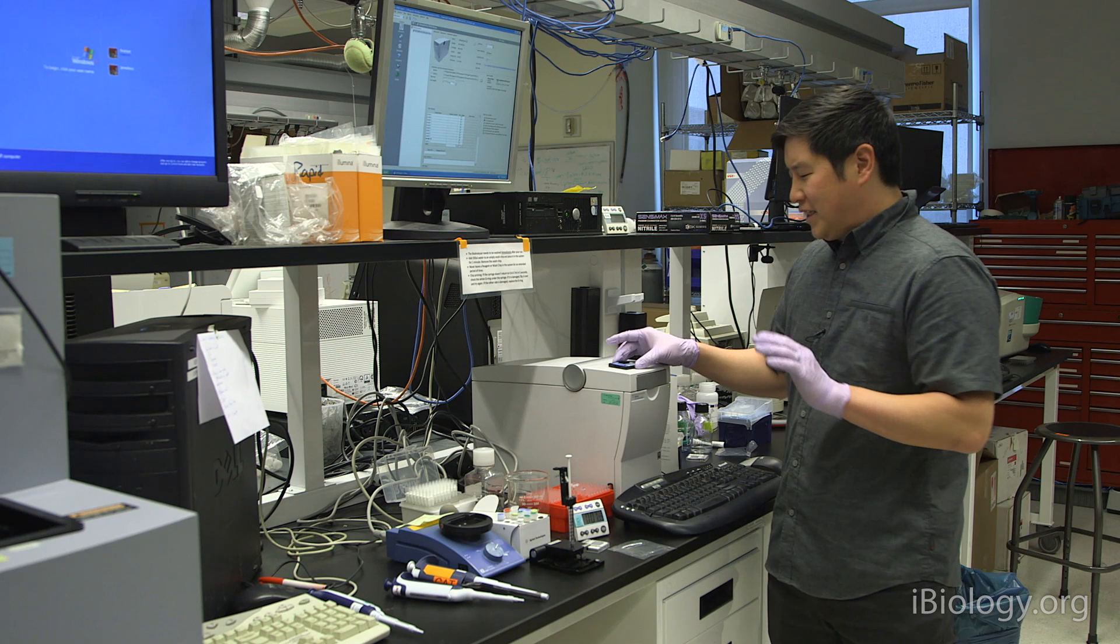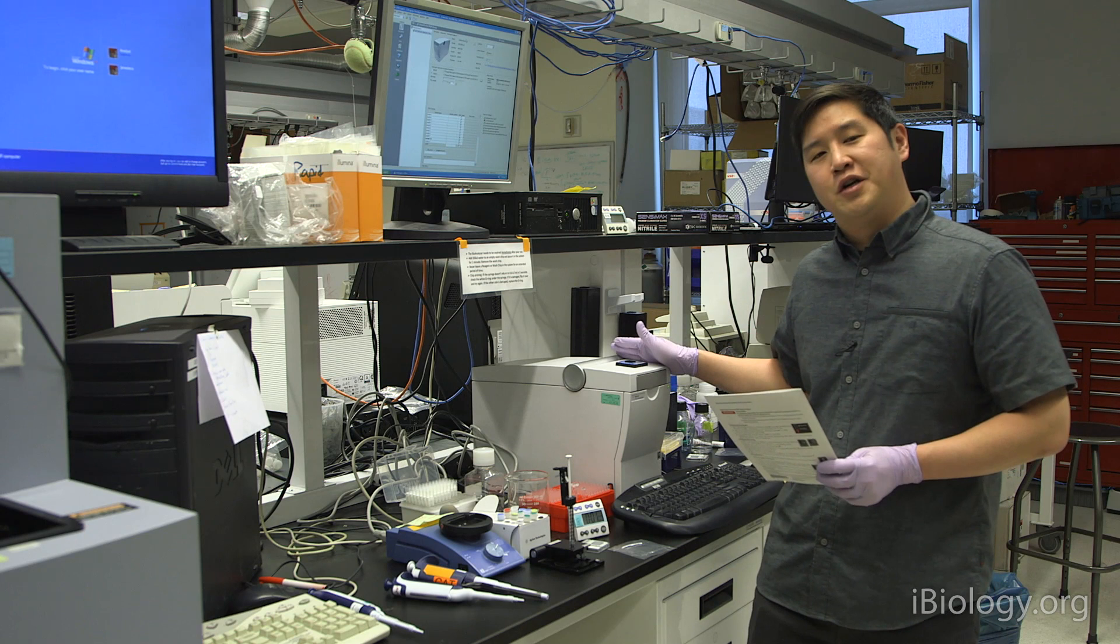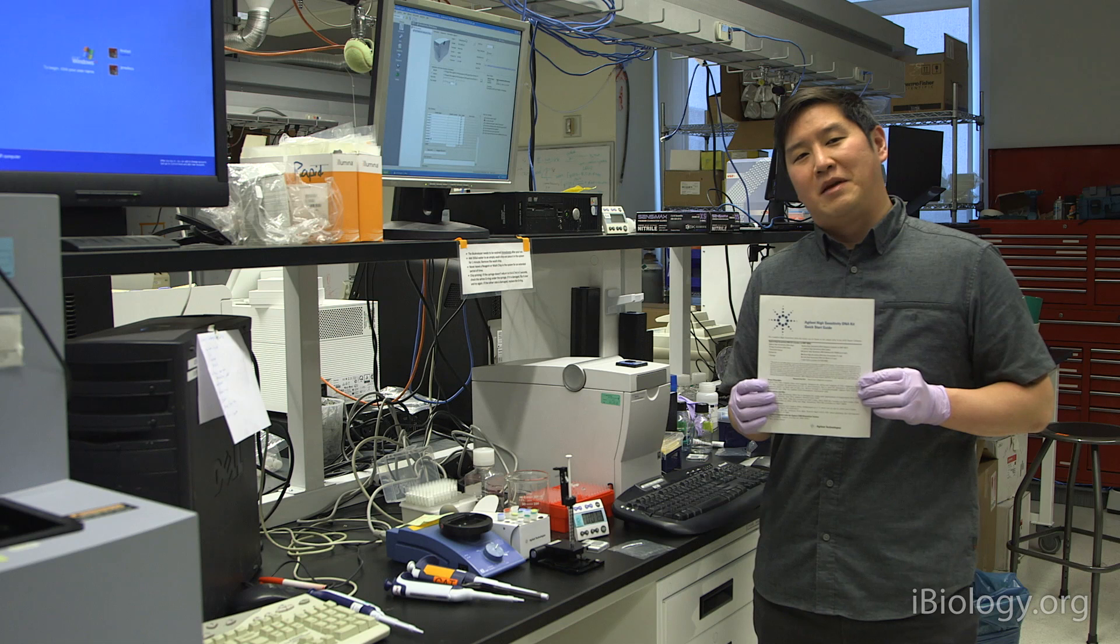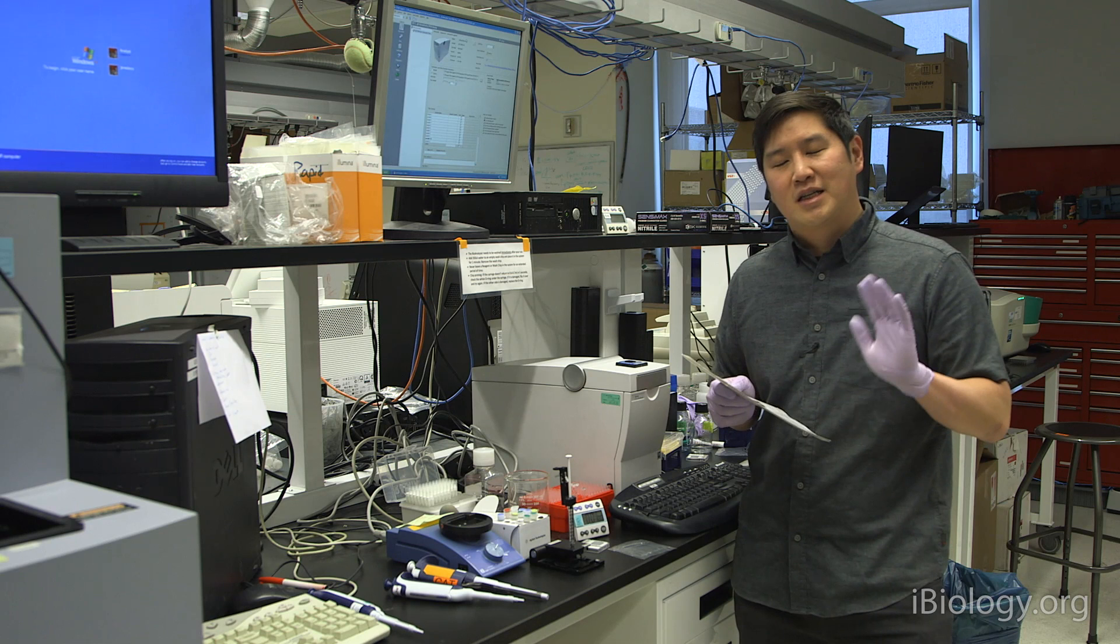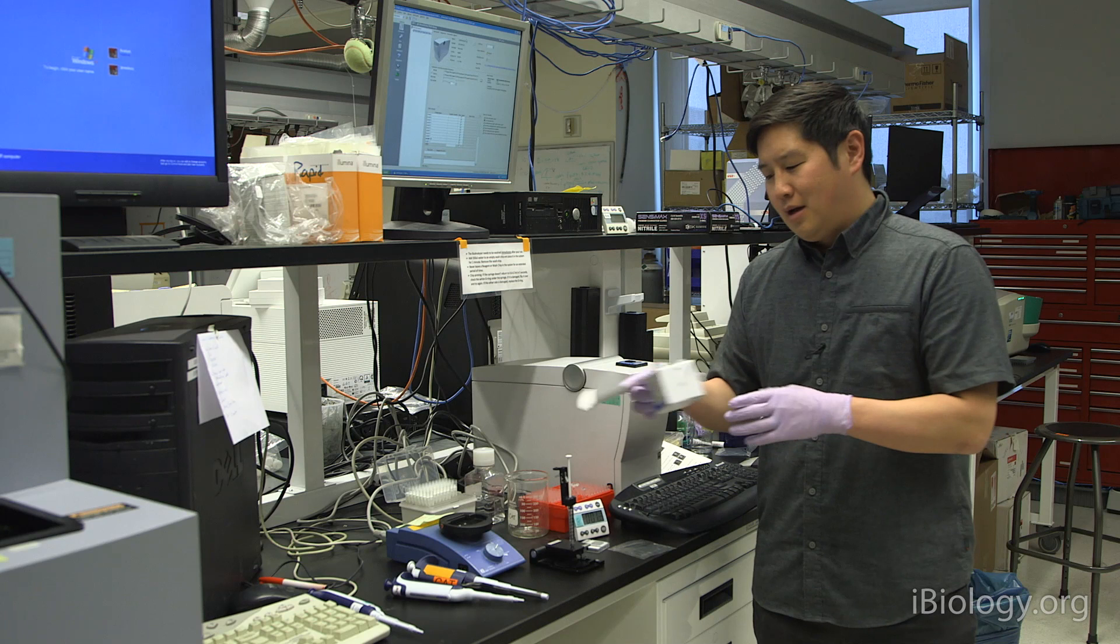We haven't done anything to prepare the chip yet, and we'll go through that next. With all the different kits for the Bioanalyzer, you can analyze both RNA and DNA. They come with a handy user guide that we'll essentially be following today. In this user guide, there are sections where it tells you to prepare a gel dye mixture. This is something you'll have to do ahead of time, and it takes about 30 minutes. This is something we've done before we've shot this video.